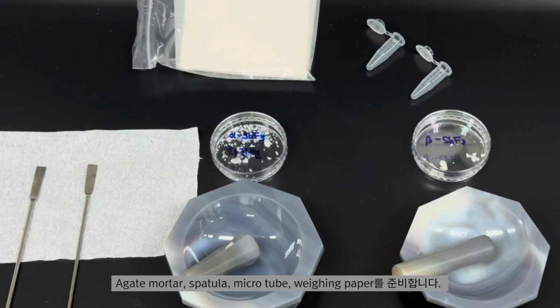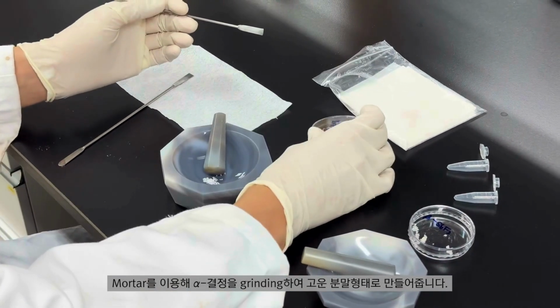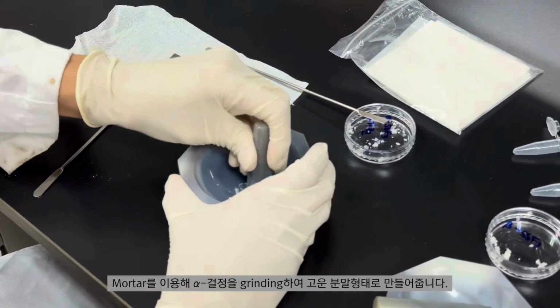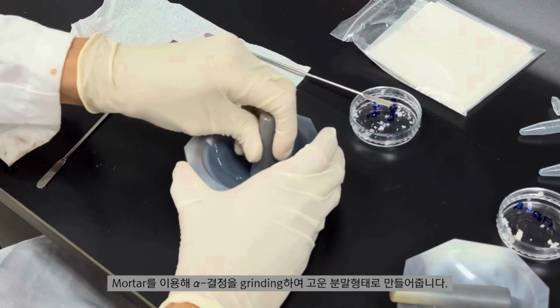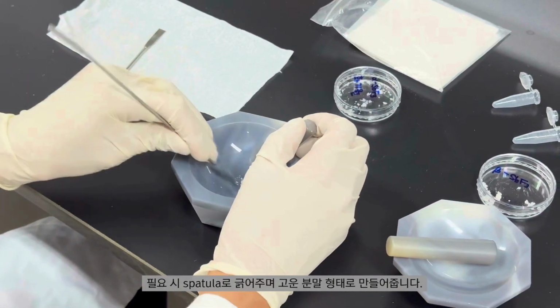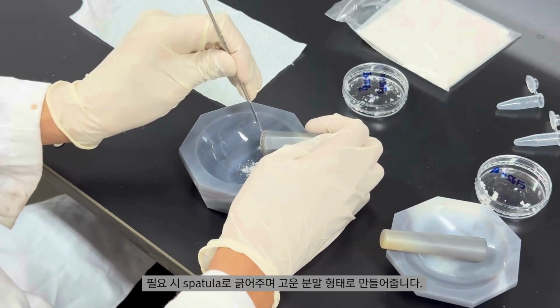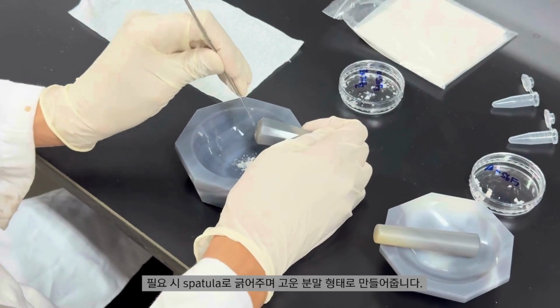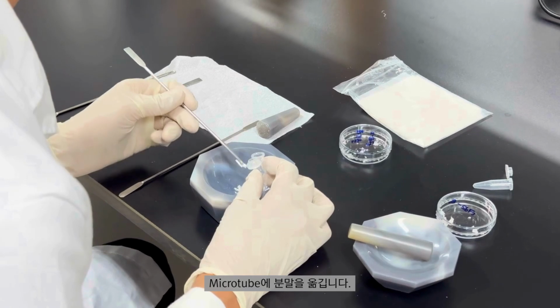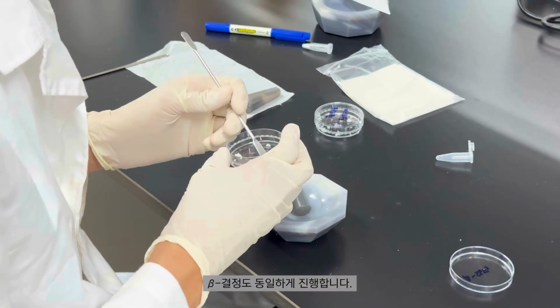Prepare agate mortar, spatula, microtube, and weighing paper. Using the mortar, grind the alpha crystals into a fine powder. If necessary, use the spatula to scrape the material and ensure a uniform fine powder. Transfer the powder into a microtube. Repeat the same procedure for the beta crystals.